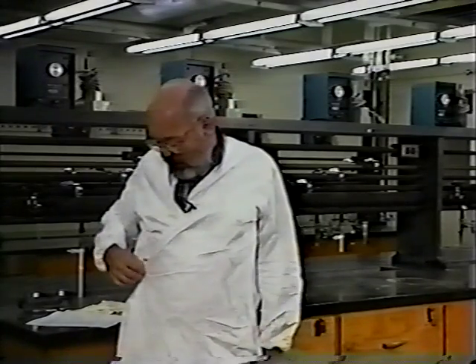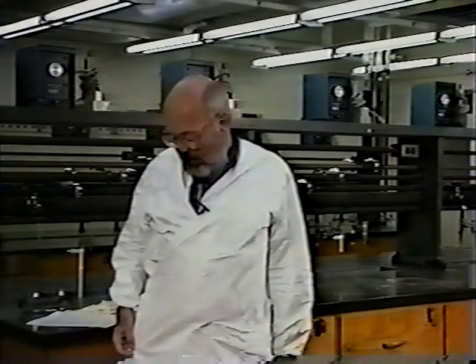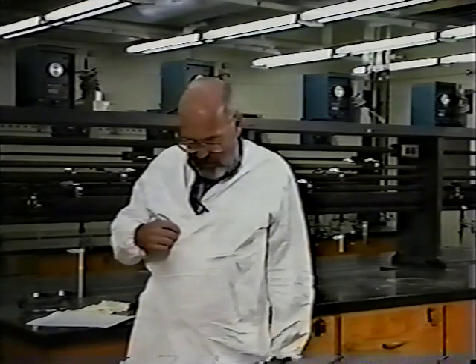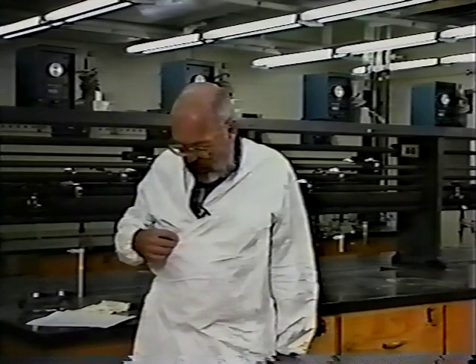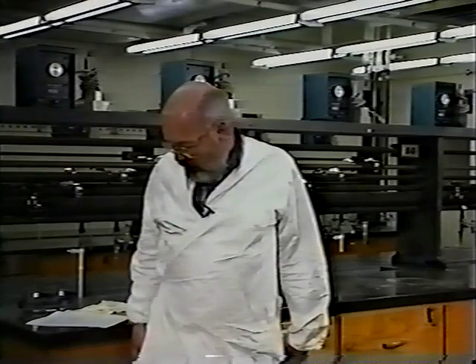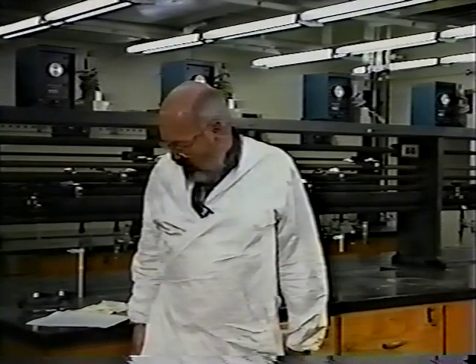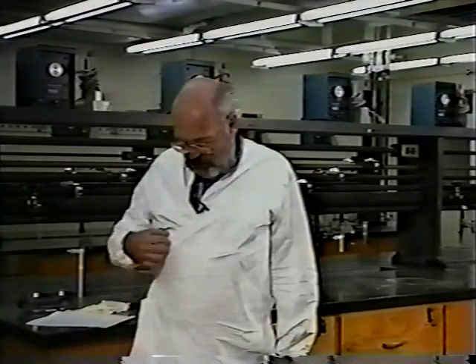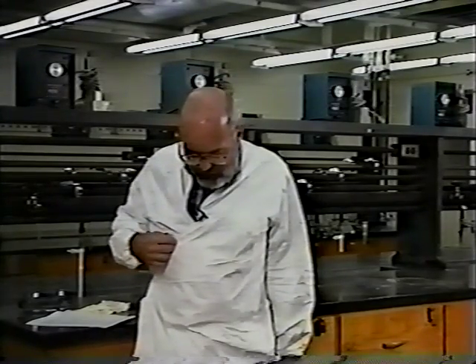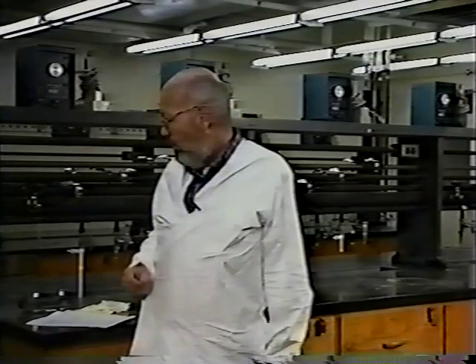If you do not have a lab coat, I recommend these Tyvek plastic ones, which are inexpensive and which meet the requirements of the laboratory and are available at small cost from the stock room. It is a great deal less expensive to wear such protective clothing than it is to replace clothing which has been damaged accidentally in the course of an experiment.